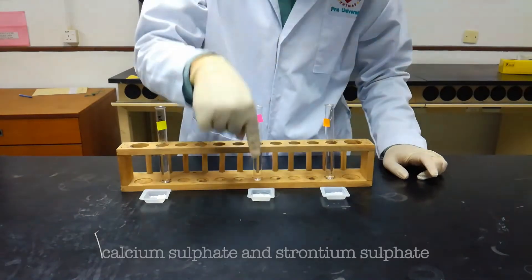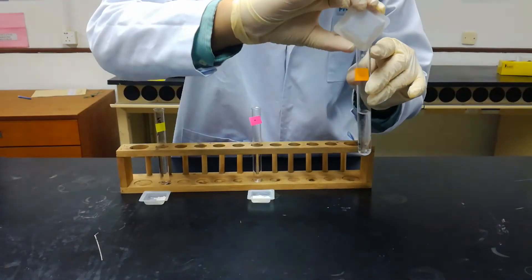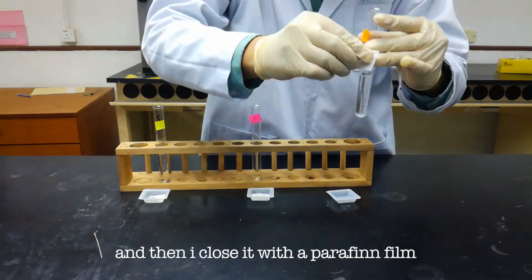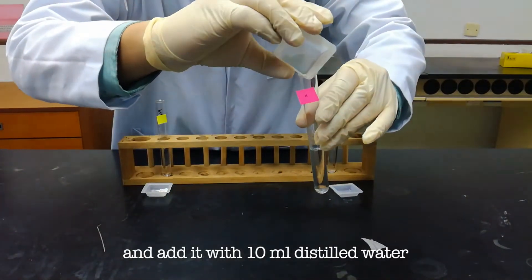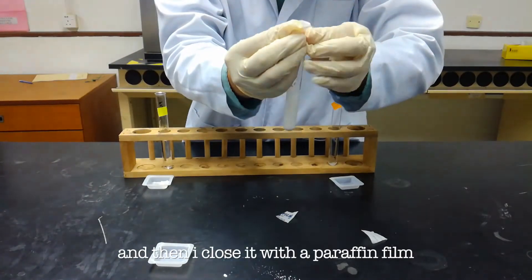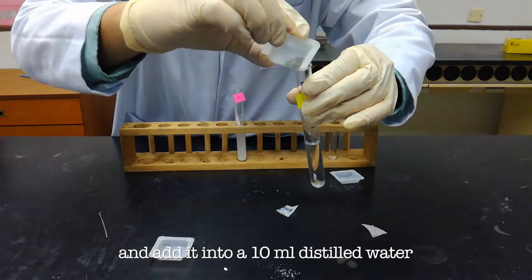We shall start the experiment now. Here I have magnesium sulfate, calcium sulfate, and strontium sulfate. I put the magnesium sulfate into 10 ml of distilled water, then close it with a paraffin film. Next, I use the calcium sulfate and add it with 10 ml of distilled water, then close it with a paraffin film. And lastly, I do the same with strontium sulfate, adding it into 10 ml of distilled water.